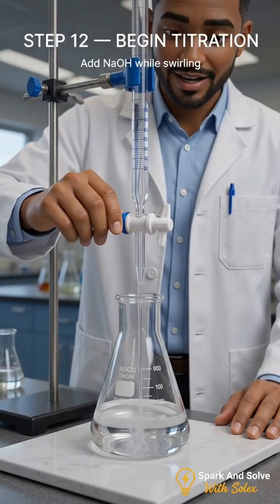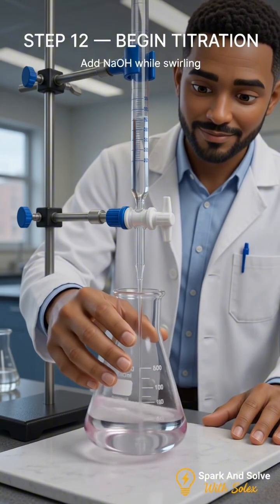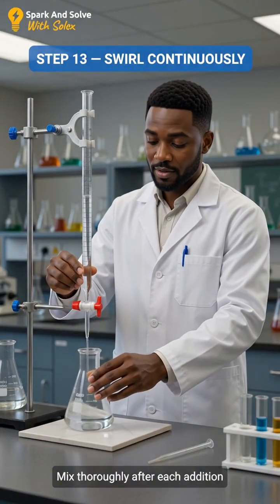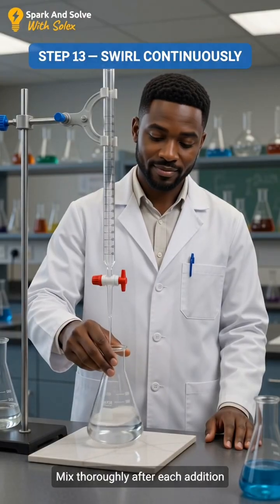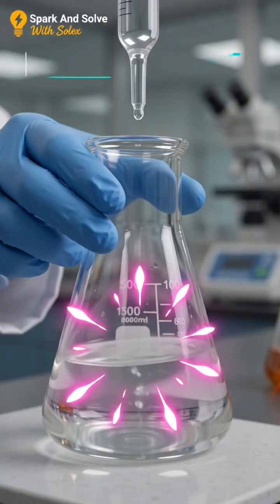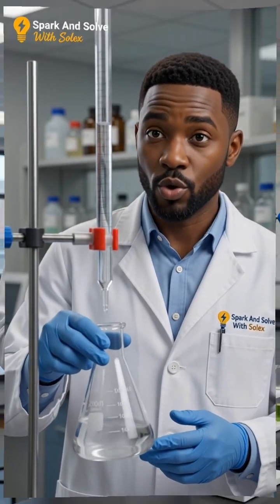Open the stopcock and allow the sodium hydroxide to flow into the flask while continuously swirling the solution. Keep swirling continuously so that every drop of sodium hydroxide reacts completely with the acid. Notice the color change. At this stage, the pink color disappears as the solution is swirled.